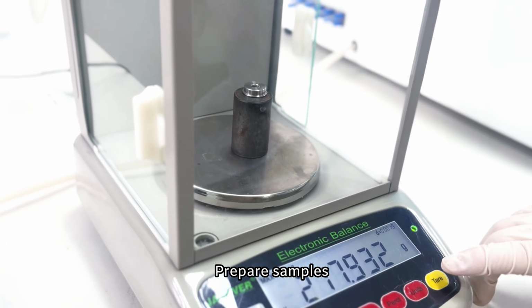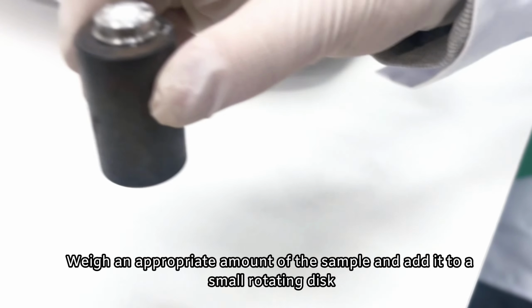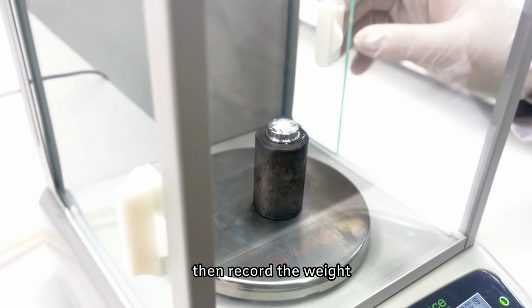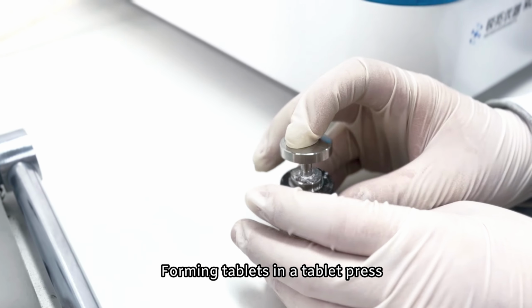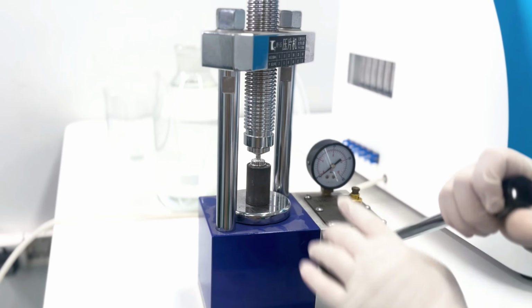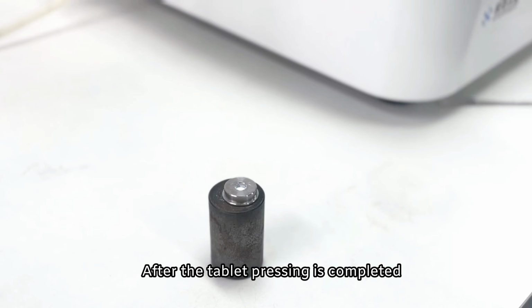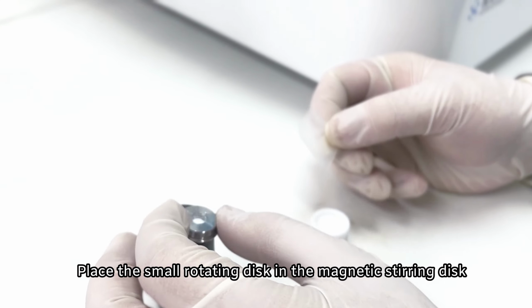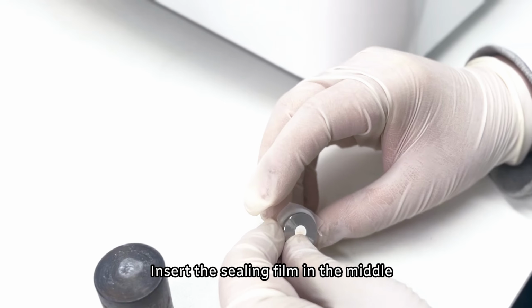Prepare samples. Weigh an appropriate amount of the sample and add it to a small rotating disc, then record the weight. Then place the cover onto the rotating disc, forming tablets in a tablet press. After the tablet pressing is completed, place the small rotating disc in the magnetic stirring disc. Insert the sealing film in the middle.